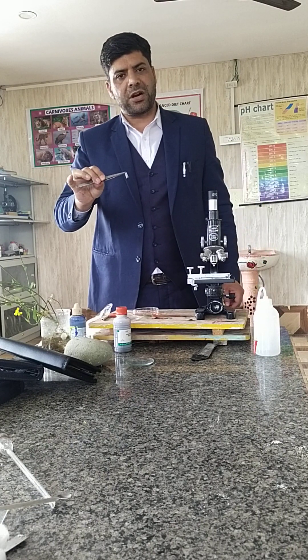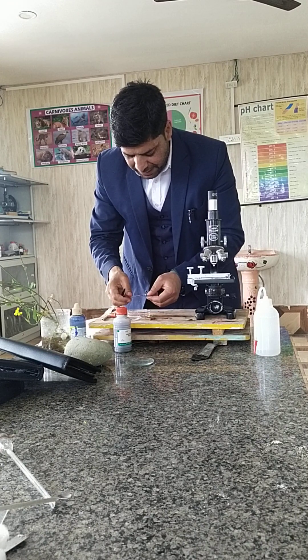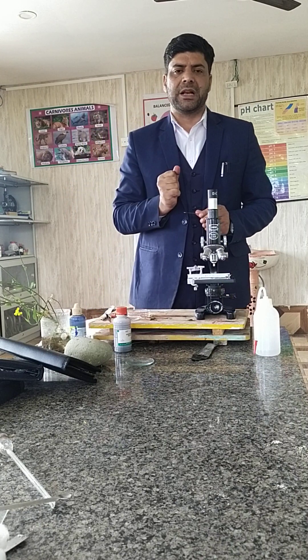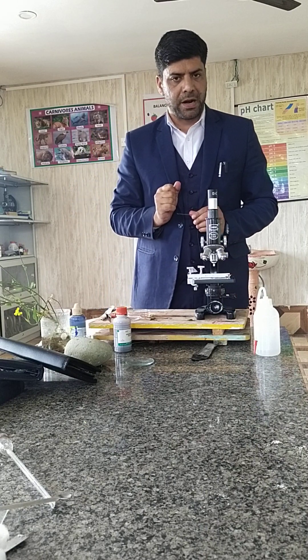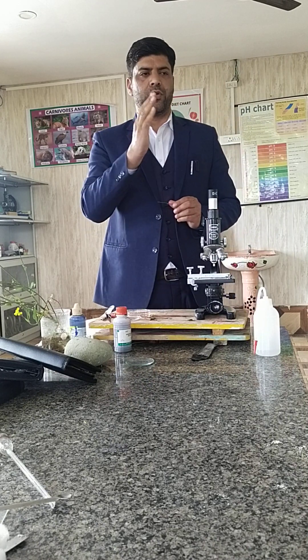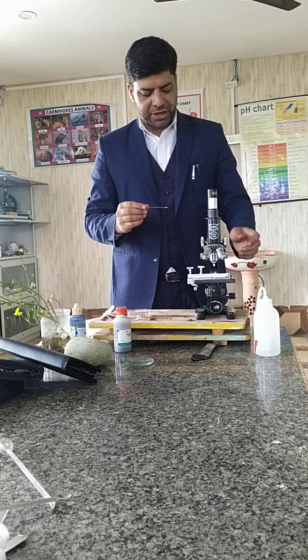This sample I will put on the slide so you can see the structure of the stomata. You have read about stomata — they are bean-shaped or kidney-shaped cells in the dicot leaf, and dumbbell-shaped in the case of monocot plants. The important functions of stomata are transpiration and gaseous exchange.